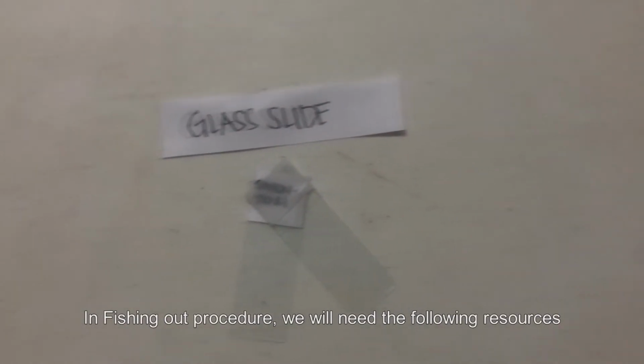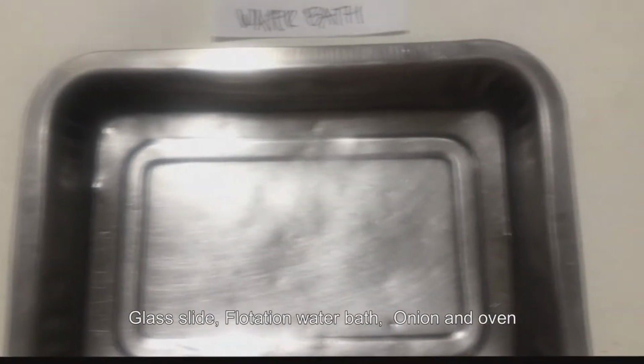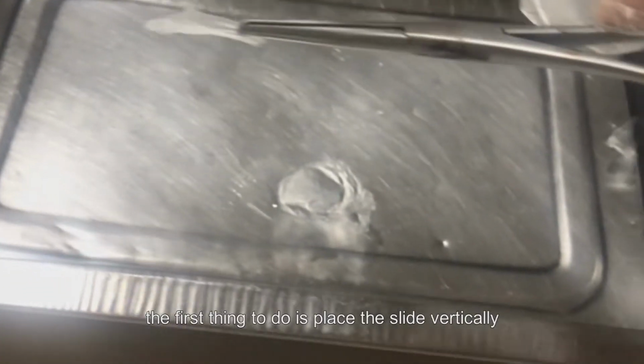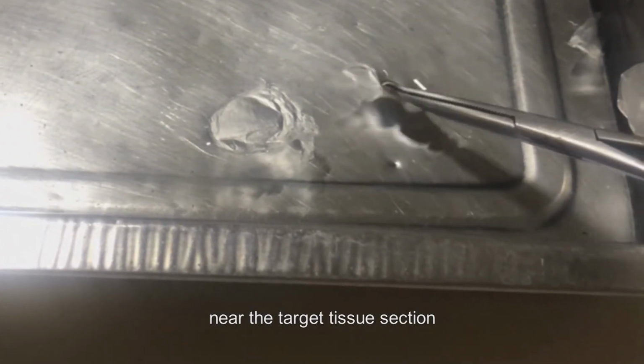In fishing out procedure, we will need the following resources: glass slide, flotation water bath, onion, and oven. In fishing out the onion tissue ribbons, the first thing to do is place the slide vertically near the target tissue section.